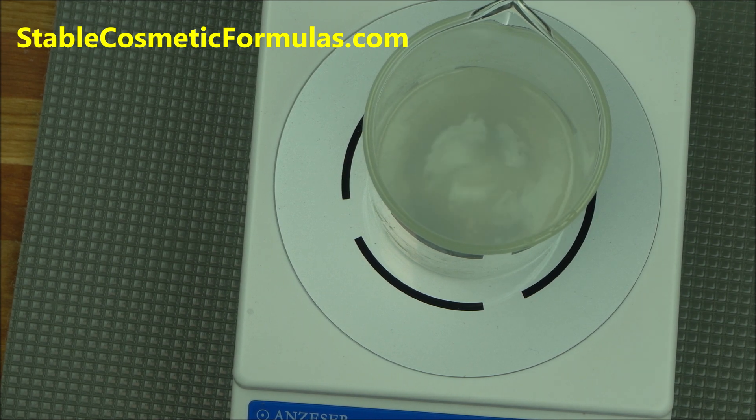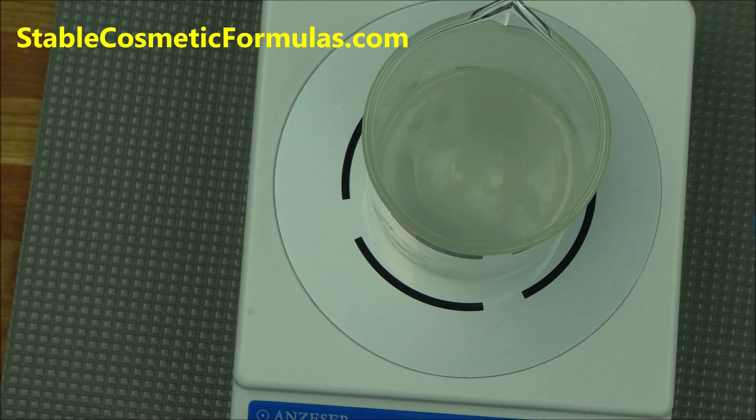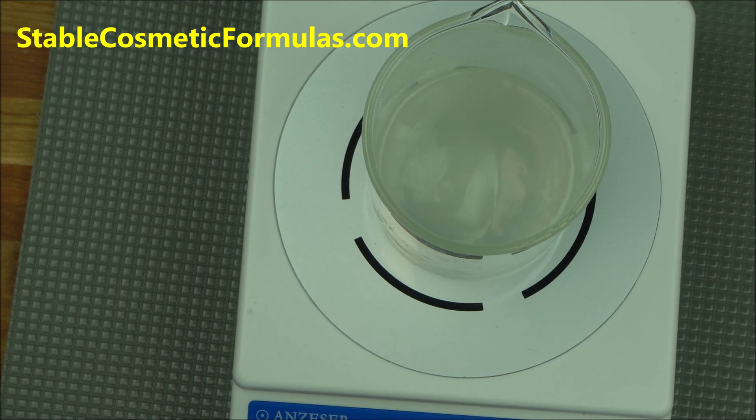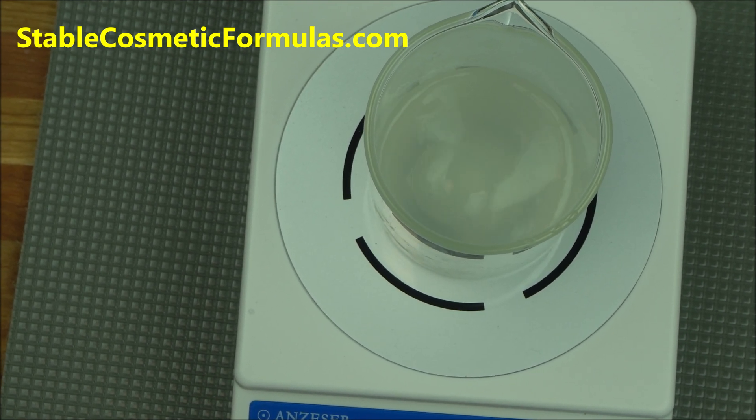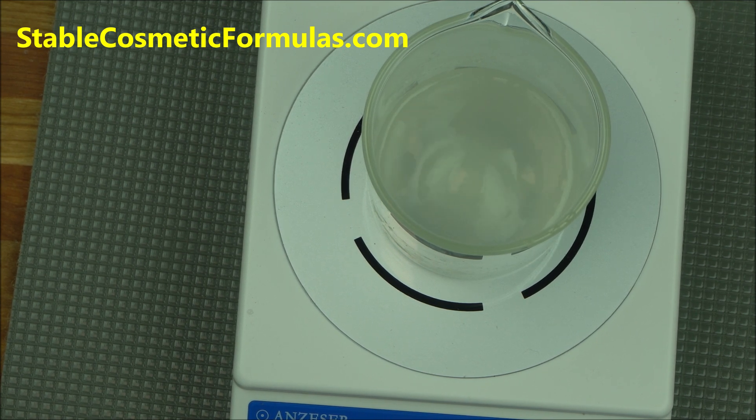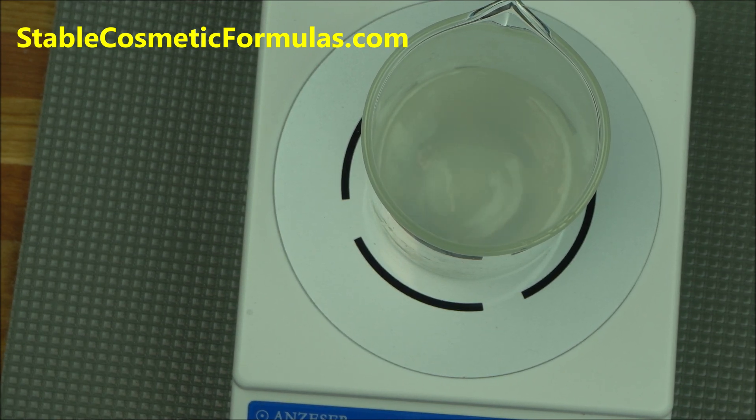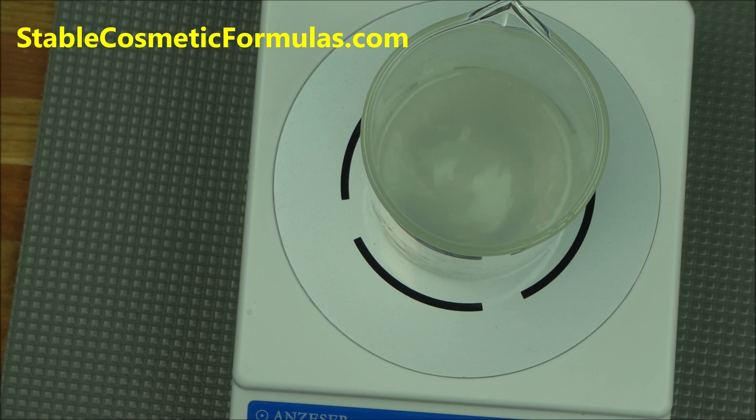Vortex is the key and that's what a magnetic stirrer will do. It produces a vortex that makes your blending smoother. Vortex technology has been in use by manufacturers in the commercial industry for a while. A magnetic stirrer or even an overhead stirrer will create vortex for you depending on the propeller you are using.